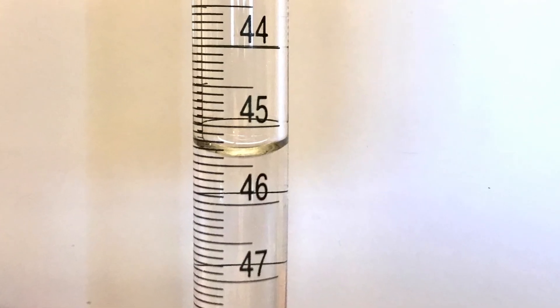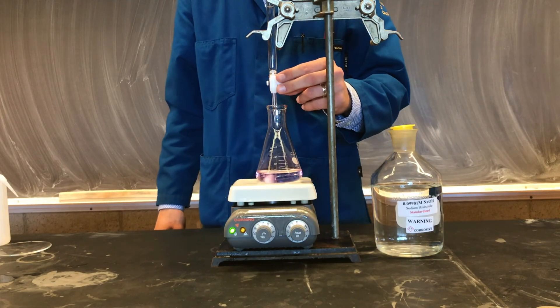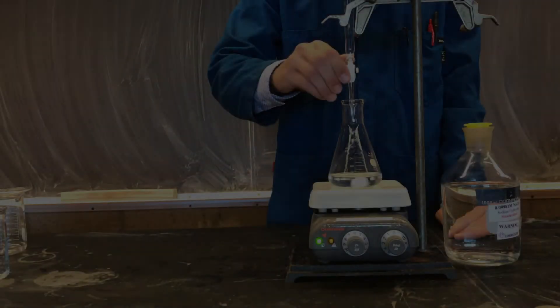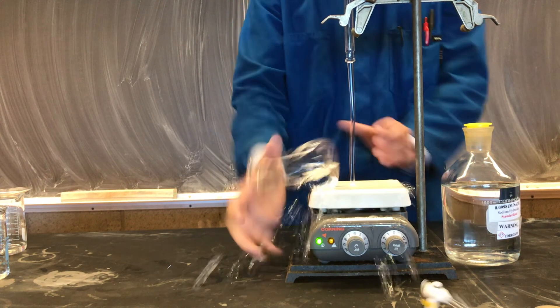Carefully record the final burette volume. Best of luck completing the lab with your group — ask your instructor if you have any questions. As promised, here's what happens when you forget to ensure that your stopcock is properly installed.